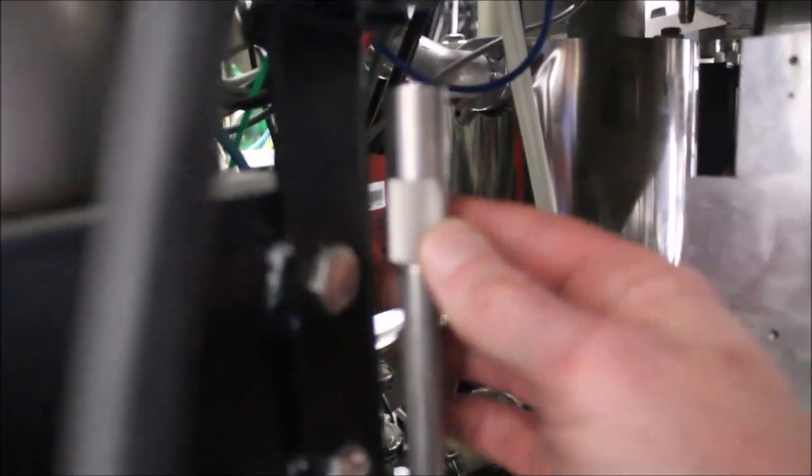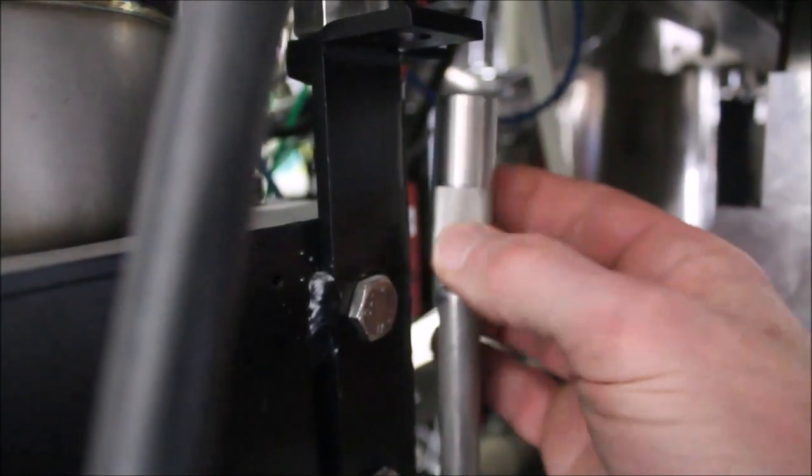Now that we have all these nuts disconnected, we need to come back here and turn the crank so that the little antennas that support the cables are retracted.